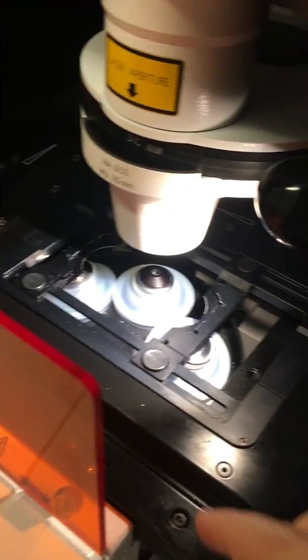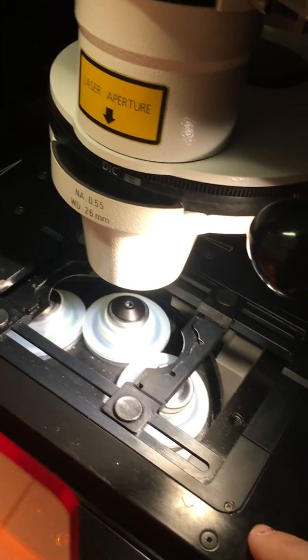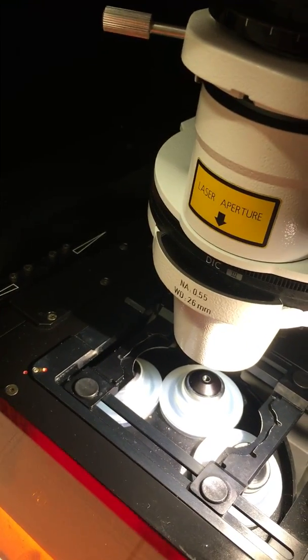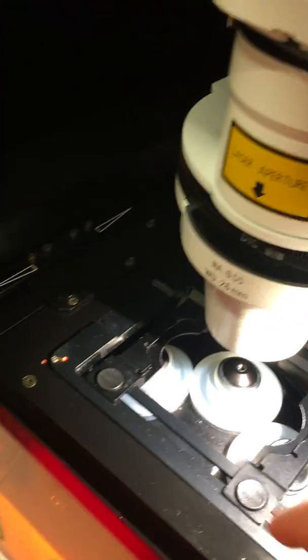Both our confocal microscopes have fancy stages with different types of frames. This one is for sample glasses, and I quite often see that it's not fitted in properly. And you cannot scan your samples when the frame is not in a proper position.